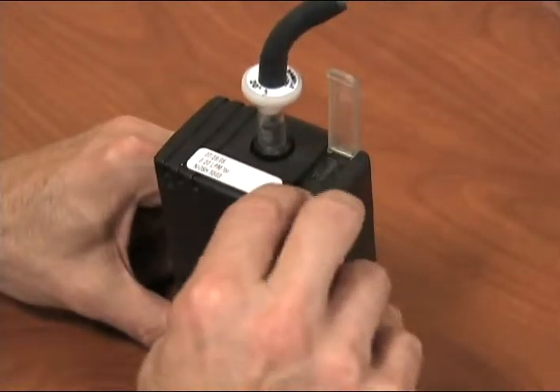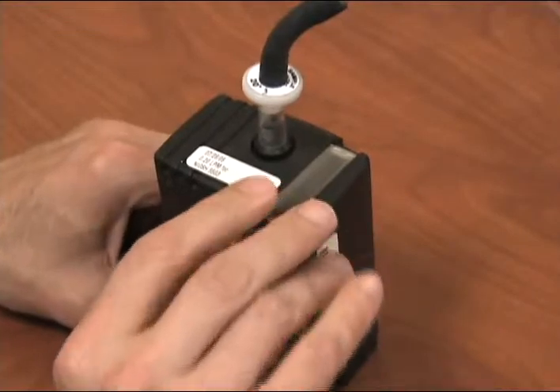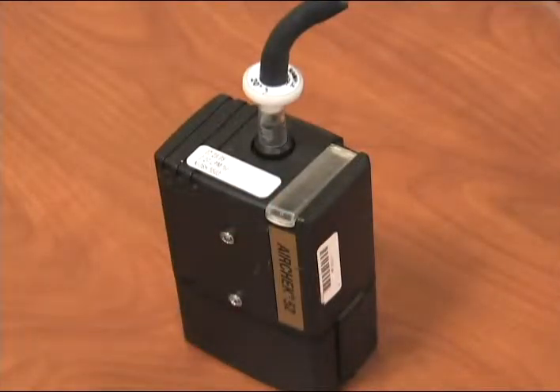Start the pumps as they need to warm up for at least three minutes before you begin the calibration. Be sure to verify the pump flow rates in an area where you are not exposing the media and equipment to the contaminant, like an office setting.